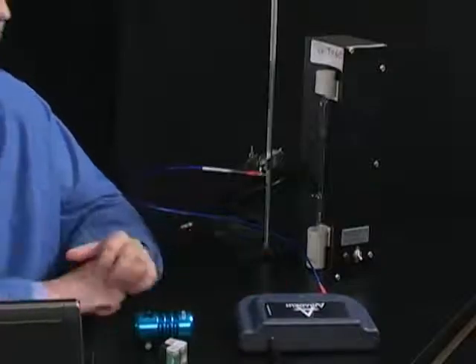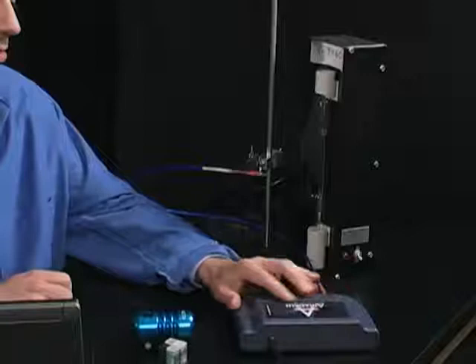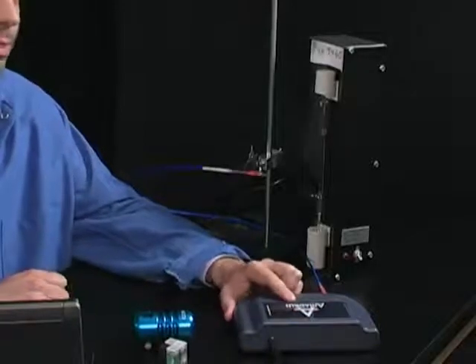A spectrometer is essentially a very fancy prism or diffraction grating, and it takes light and separates that light into its various wavelengths, and it can measure the intensity of those wavelengths, and that's where it gets interesting for us. So let me show you how we can use our introductory Amadeus spectrometer from Ocean Optics in a chemistry setting.